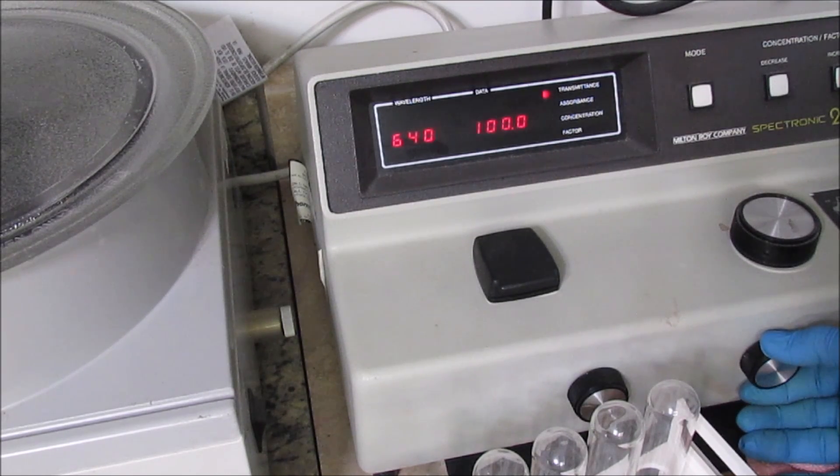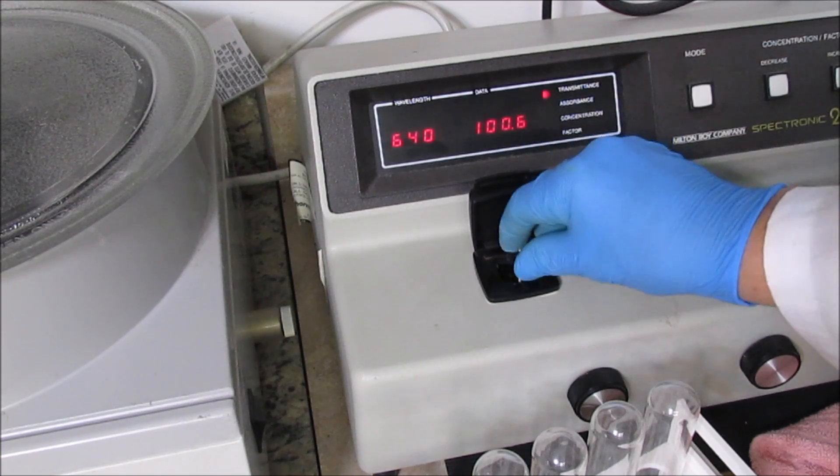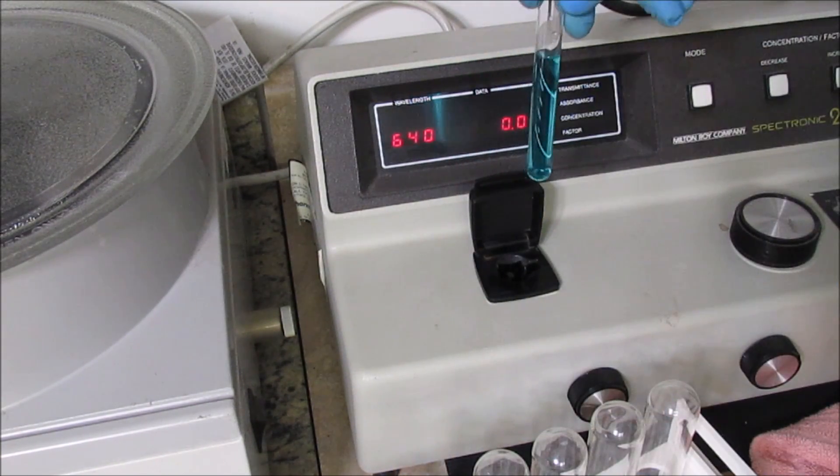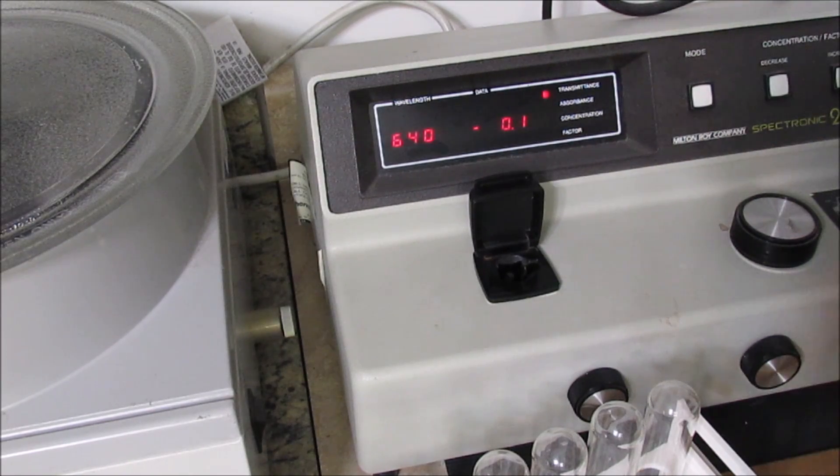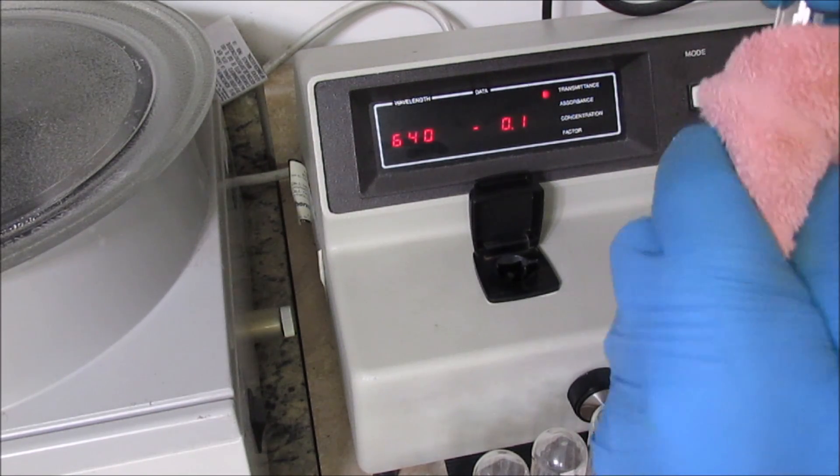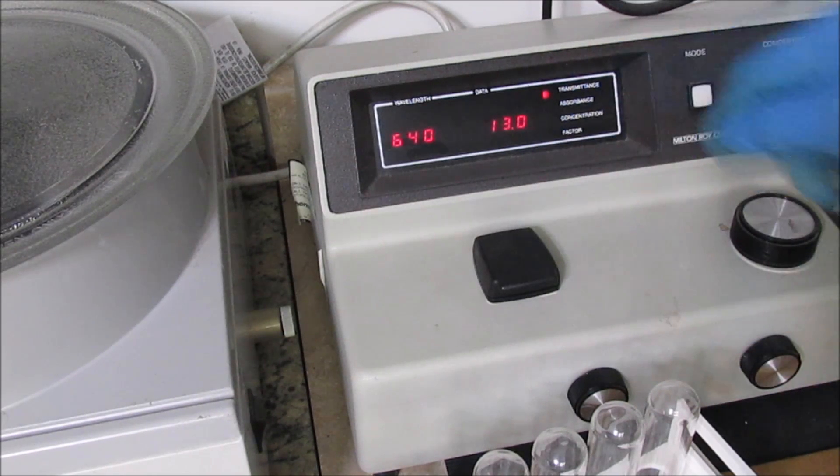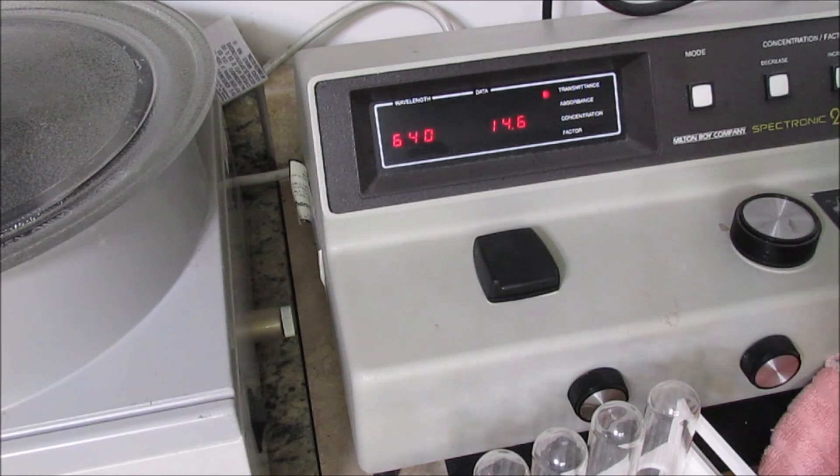Once I get it set to 100, I take out my blank and insert my unknown sample here. I take a transmittance reading. I get 14.6 on the transmittance.